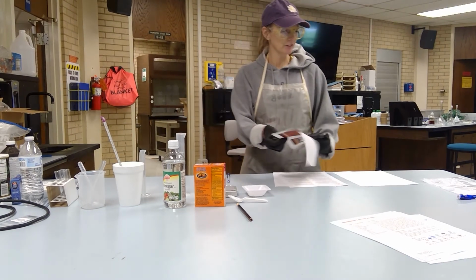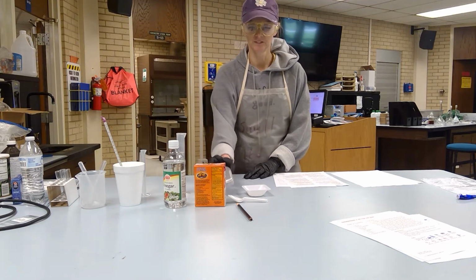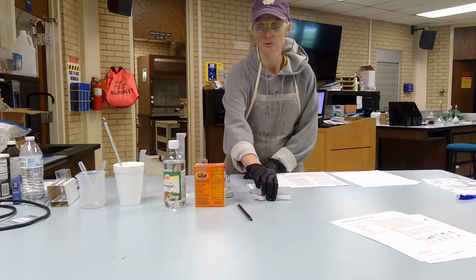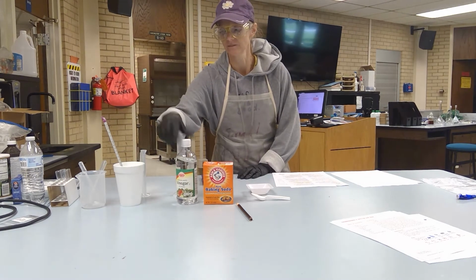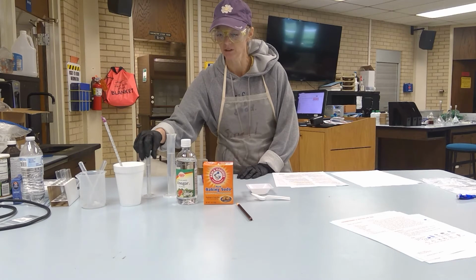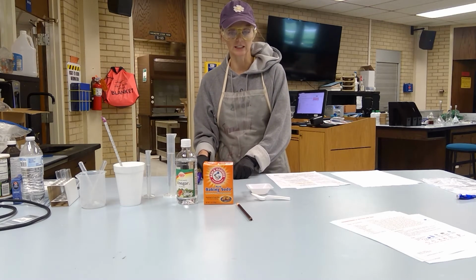Okay, and for this particular lab, you will need your scale, weigh boats, spoons, baking soda, vinegar, your 50 and 10 mil graduated cylinder, writing utensil, calculator.